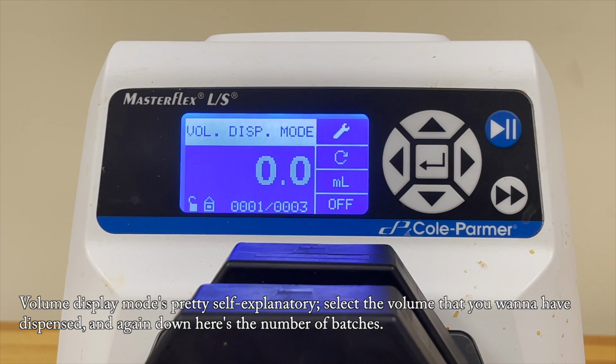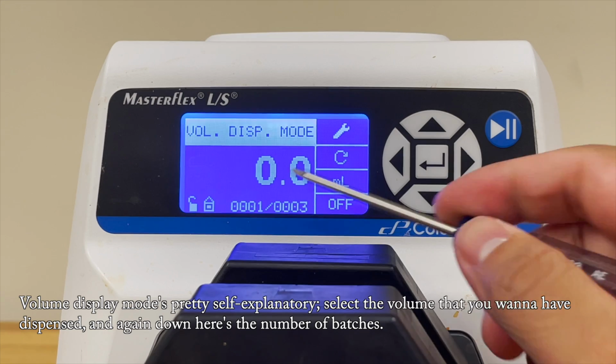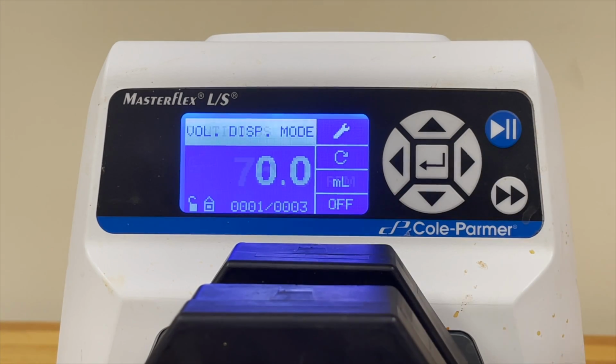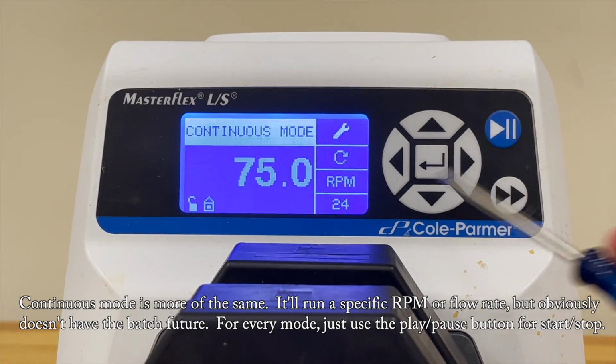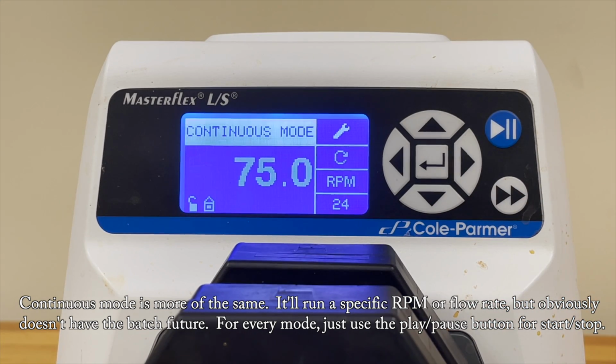Volume display mode is pretty self-explanatory. Select the volume that you want to have dispensed, and again, down here's the number of batches. Continuous mode is more of the same. It'll run a specific RPM or flow rate, but obviously doesn't have the batch feature. For every mode, just use the play pause button as a start-stop.